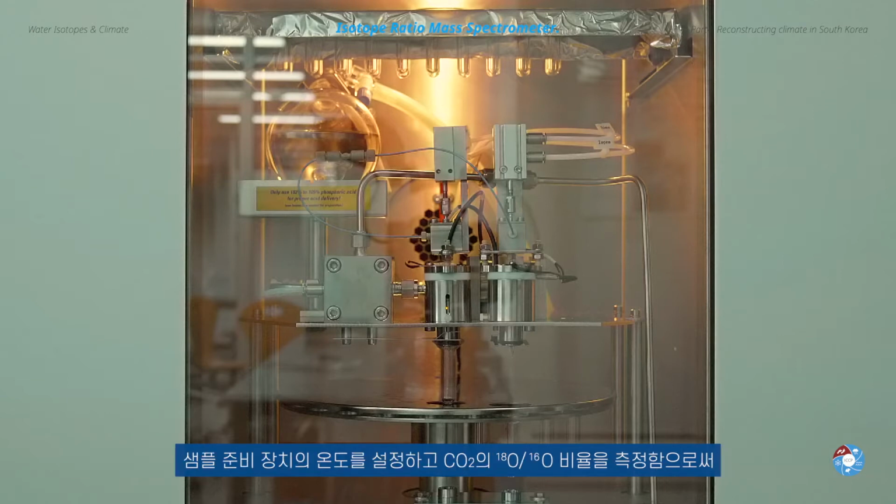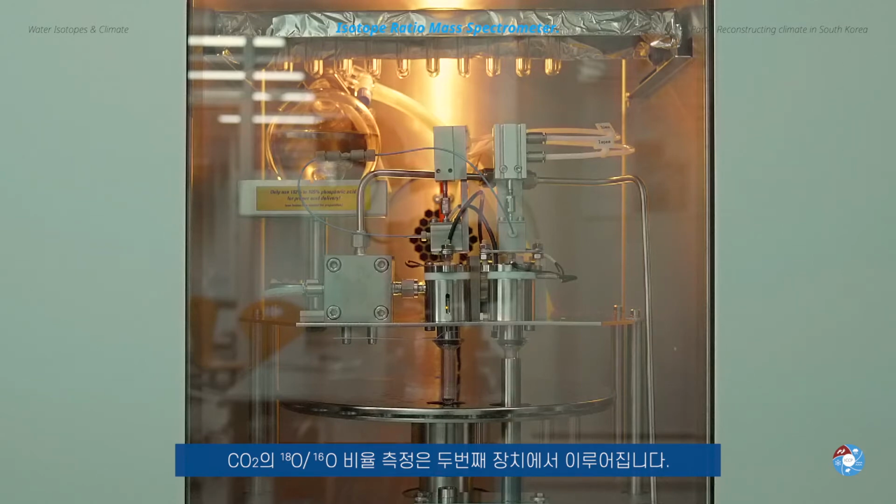By setting the temperature in the sample preparation device and by measuring the 18O-16O ratio in CO2, we can then deduce the original 18O-16O ratio of the calcium carbonate sample. The 18O-16O measurements of CO2 are conducted in this second device.